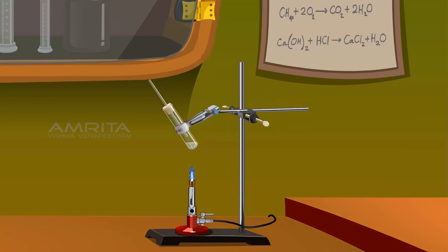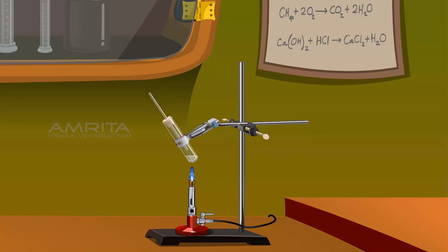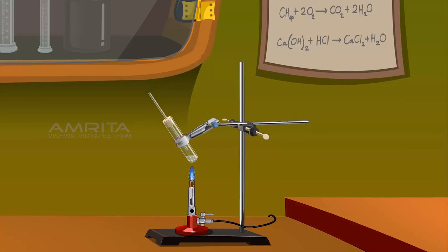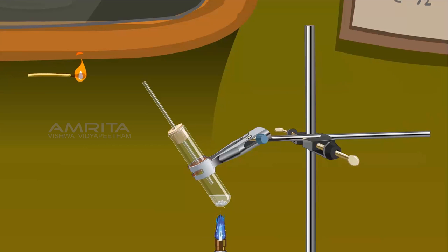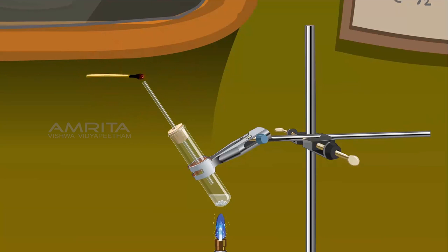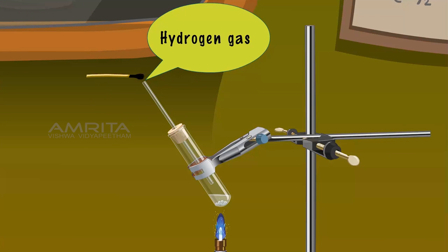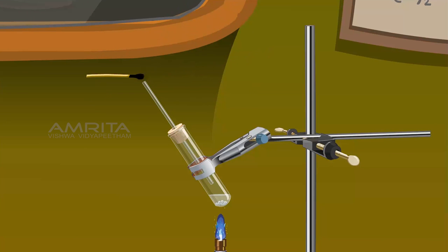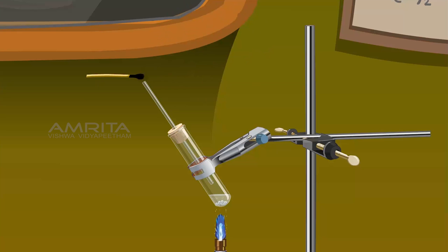Bring the clamped test tube downwards to heat it over the Bunsen burner. Hydrogen gas is evolved on heating. Take the matchbox and light a matchstick. Bring the burning match near the mouth of the jet tube. Hydrogen gas coming out of the test tube causes the flame to flare up, then with a mild explosion and producing a popping sound, the flame dips out.